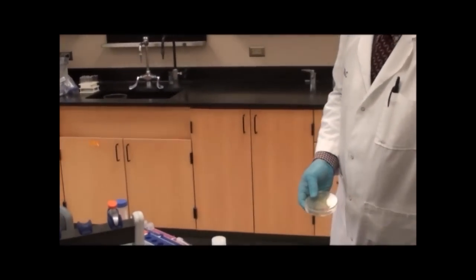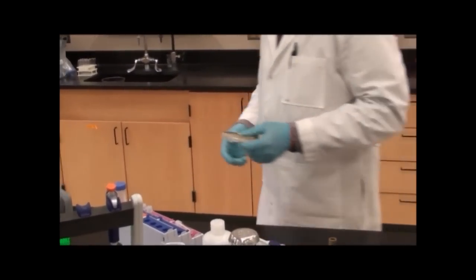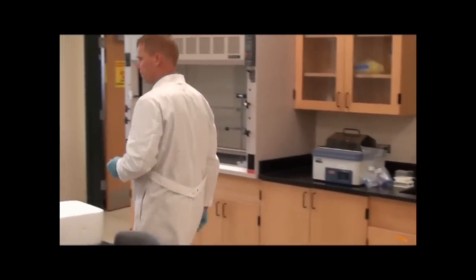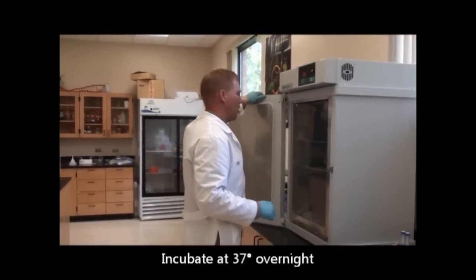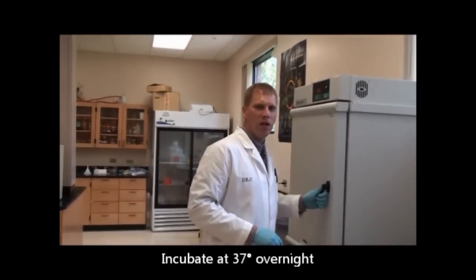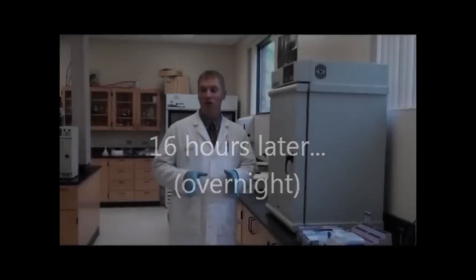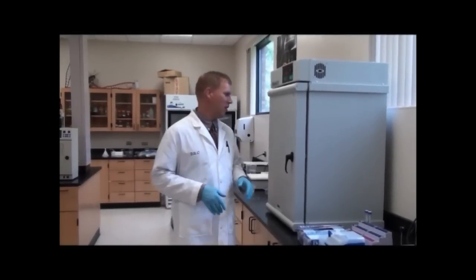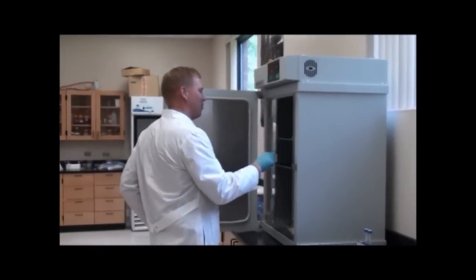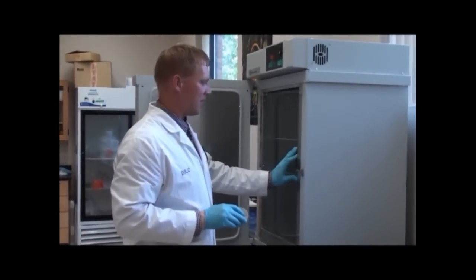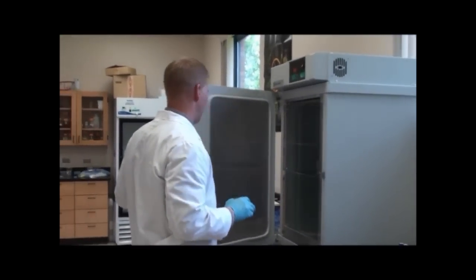Let's turn our flame off first. We'll put this in the incubator, and we will return tomorrow morning to select our colonies. It's been about 16 hours later, and we're going to pull our selective media plate out of the incubator and select some colonies to grow up for our plasmid isolation.